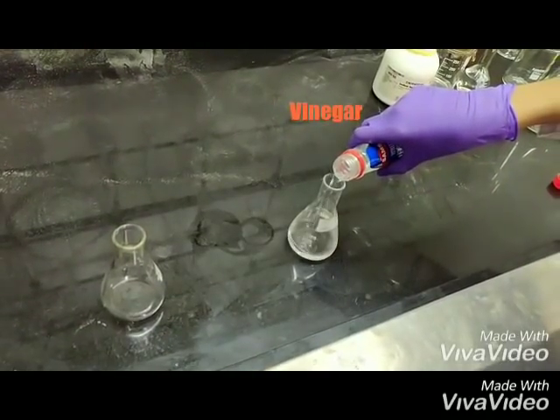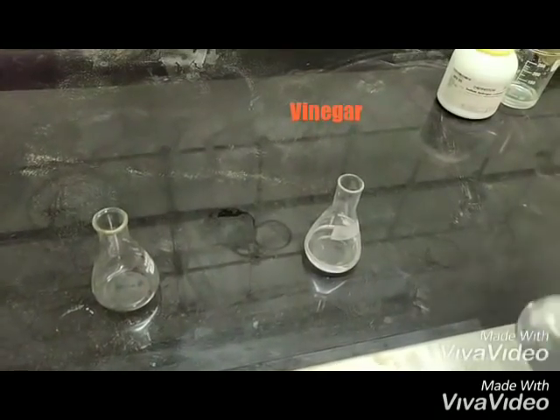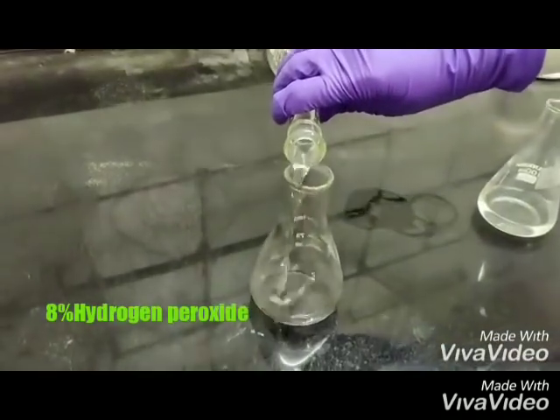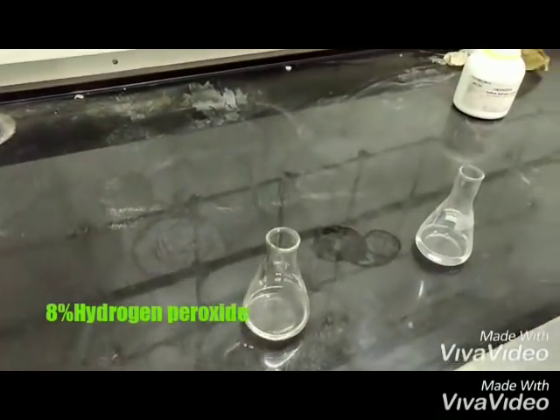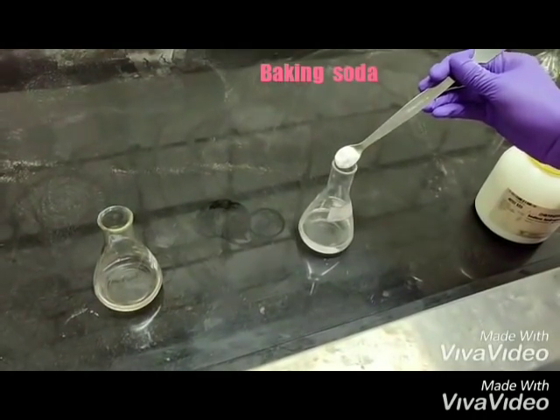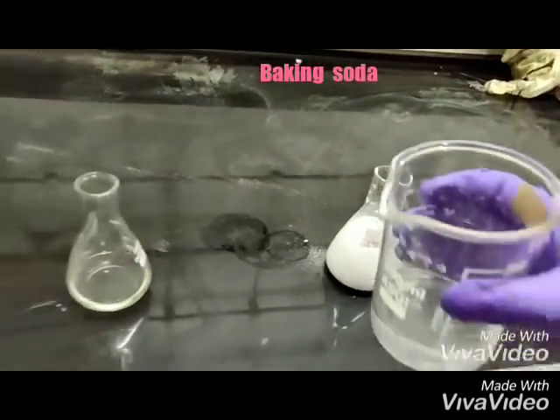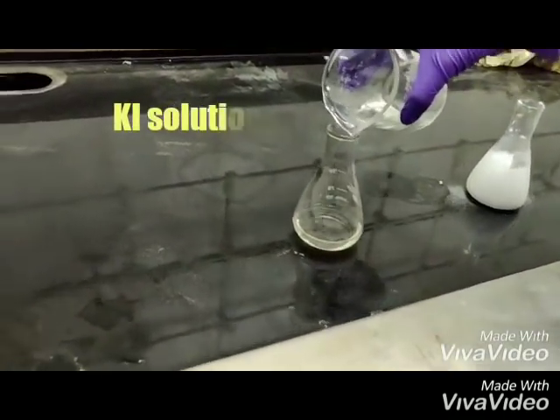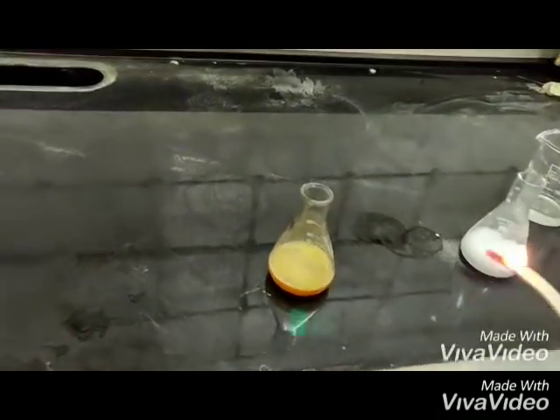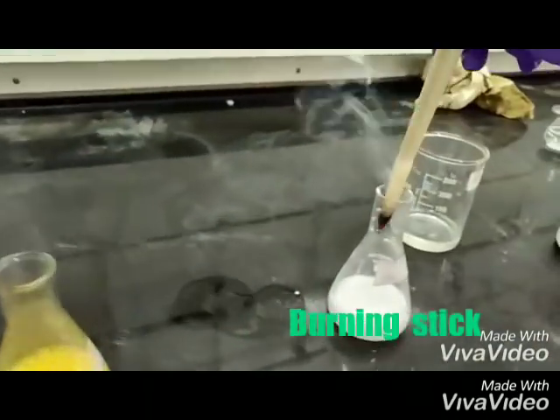Two conical flasks are taken. Vinegar is added to one flask, and then 8% hydrogen peroxide is added to the other conical flask. Baking soda is added to the vinegar, which evolves carbon dioxide. Then a solution of KI is added to the conical flask containing H₂O₂, which evolves oxygen gas.